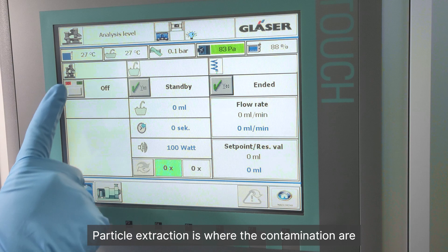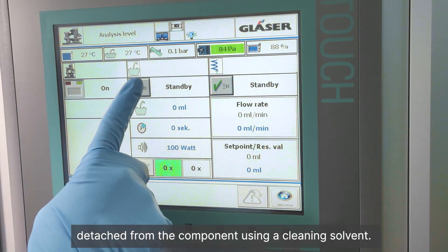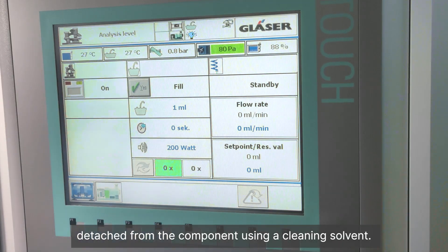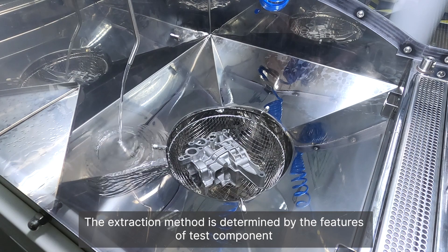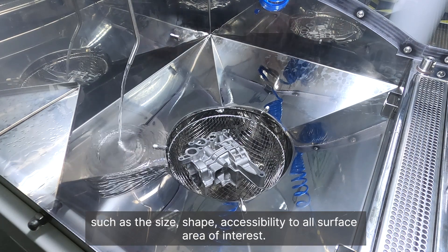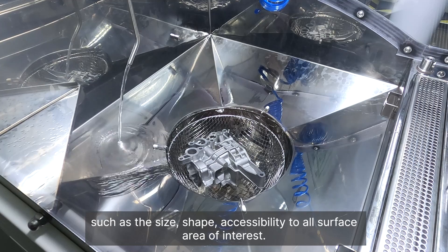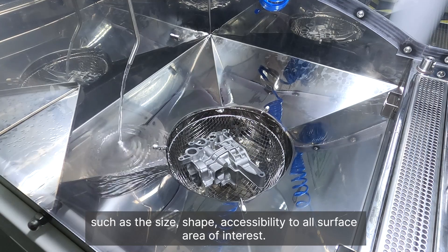Particle extraction is where the contamination is detached from the component using a cleaning solvent. The extraction method is determined by the features of the component, such as the size, structure, shape, and accessibility to all surface areas of interest.